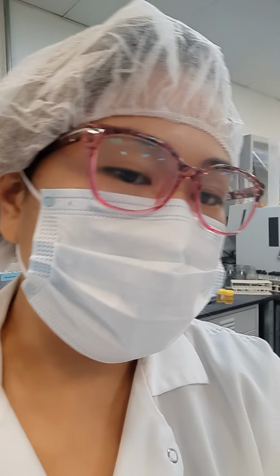So this is Kim, and I'm making this video because I'm tired of people asking what a microbiologist does, or specifically what a microbiology technician's daily work is. So I'm in the lab, BQG 52722.